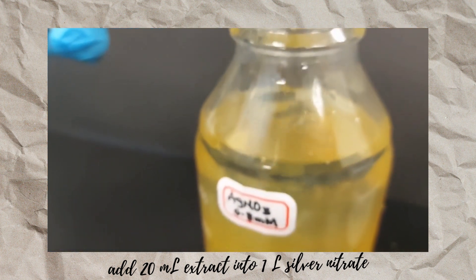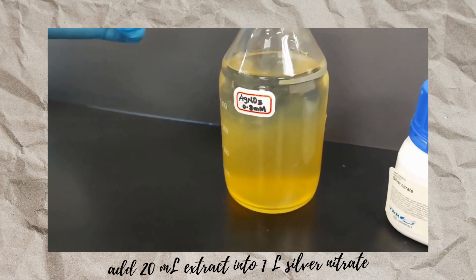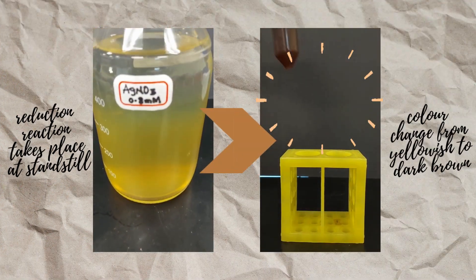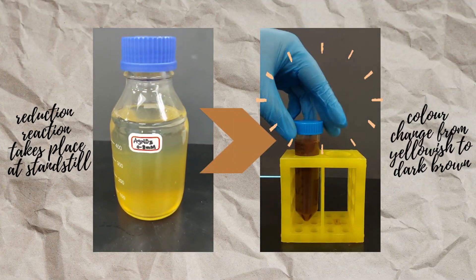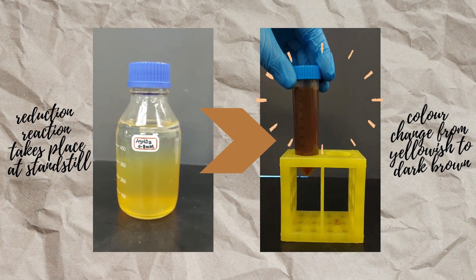Afterwards, let the reaction take place overnight in a standstill condition. You will see a color change from yellowish to dark brown. This color change subjectively indicates successful silver nanoparticles formation in a colloid.